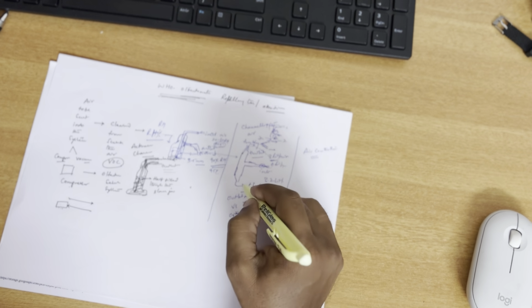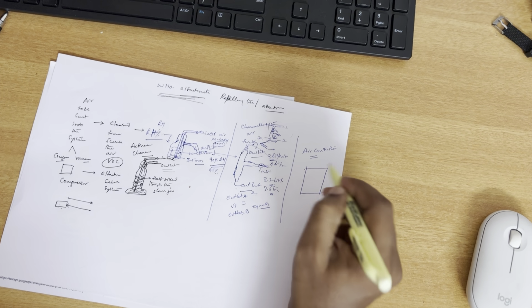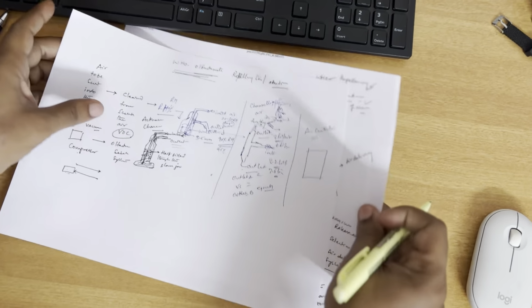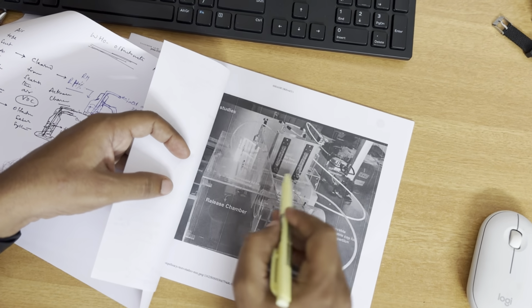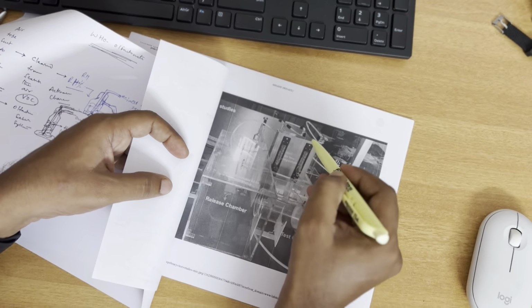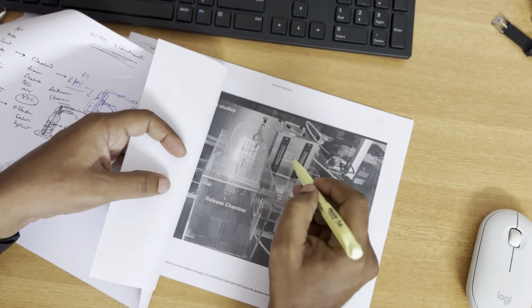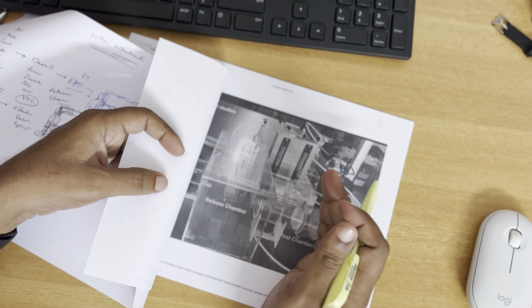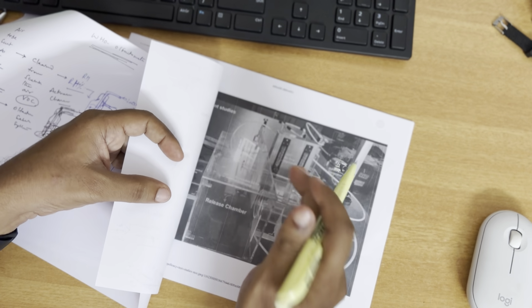Once the air is sent into the controllers, the control unit looks like this. So the real picture, the controller should look like this. This is the air controller. You see the knob here, and if you see the back side, you see the inlet and the outlet. I'm going to show you here. So this is actually the theoretical setup that we are discussing. Once we go into the detailed live video on how to do the installations, we're going to show you again.